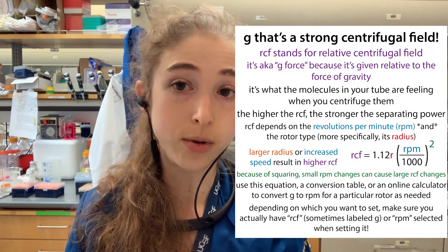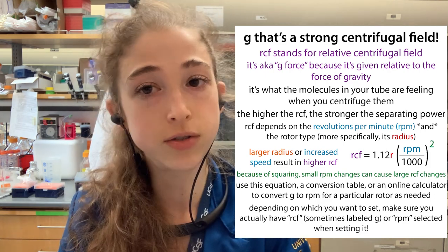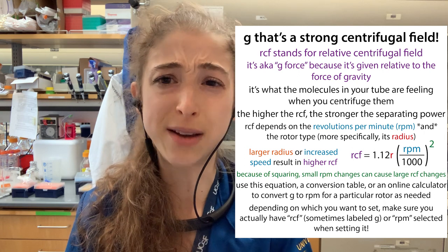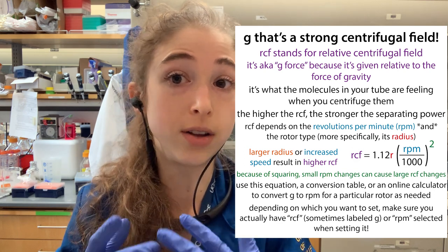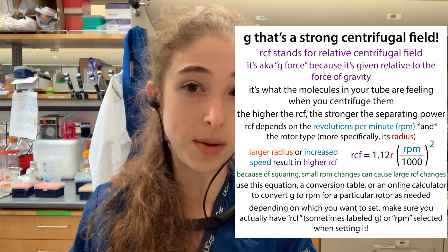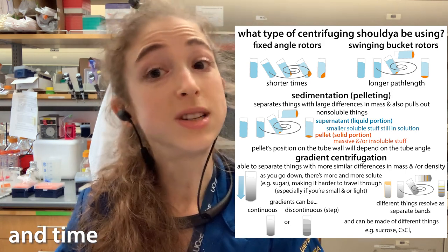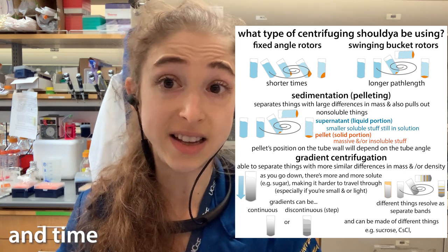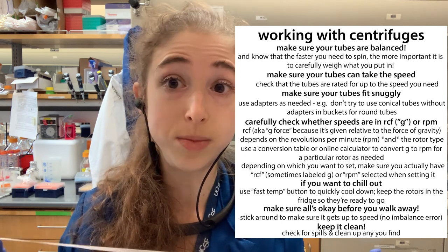Remember that the force felt — the g-force — is given as the relative centrifugal field relative to the force of gravity. Often you see it without the thousand, so if you see '40,' that's actually 40,000 g. That depends on both the rotor and the speed at which it's moving. The main things to choose are what centrifuge, what rotor, what speed, and what temperature — you can get speed and temperature from protocols, and sample size depends on your sample. Those are the basics of lab centrifuges — and remember: balance, like all things in life.